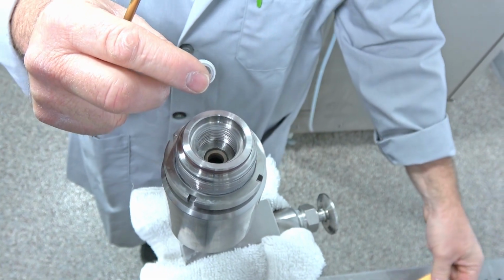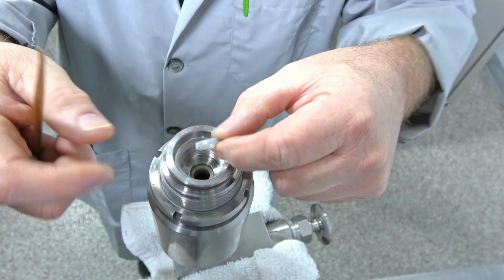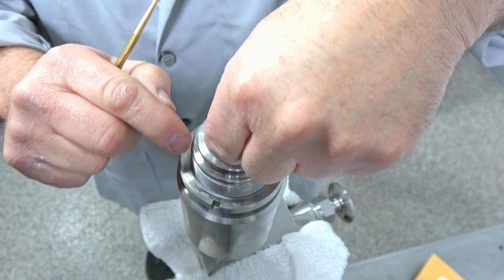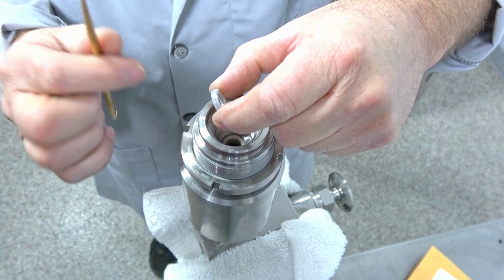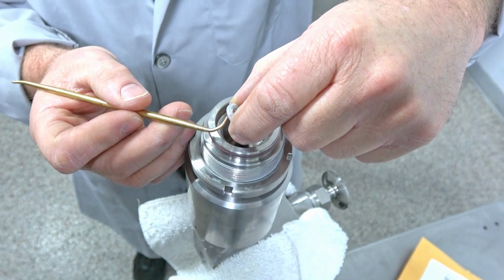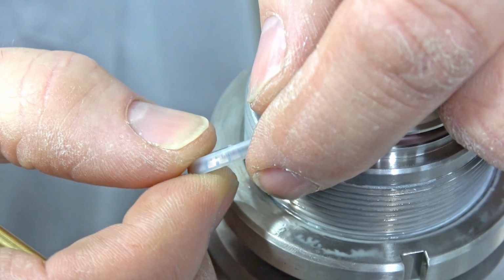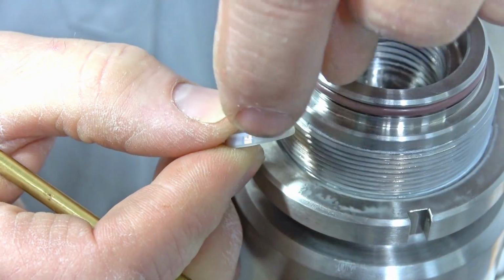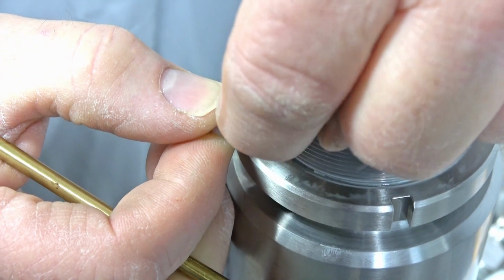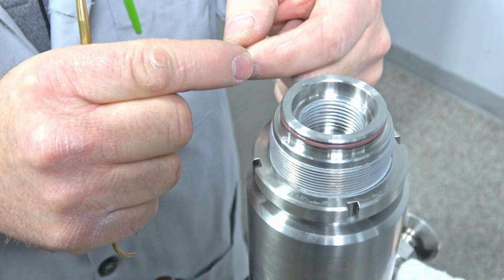Then when you put the seal back in, you're going to get a new one, and I've got new ones in this package here again. You're going to just take it and stick it down kind of like this. Stick it down and push it down, and then fold it over. The reason is because this edge here, you can't just stick it straight in, because this edge will catch. That's why you have to push it down in it, and then I usually just use my fingernail, because I don't even like to use a pick, to do that final push that edge in and seat it down, because it wedges down in there and creates that seal.